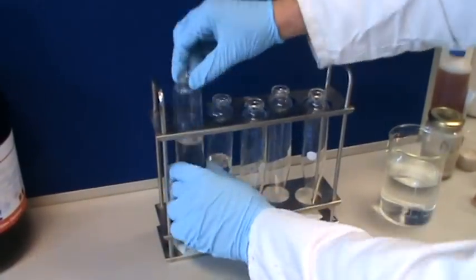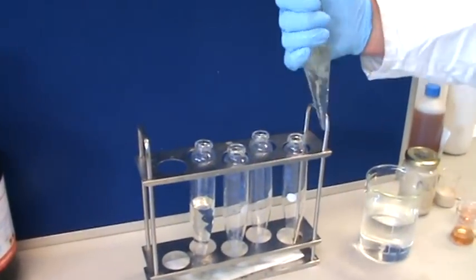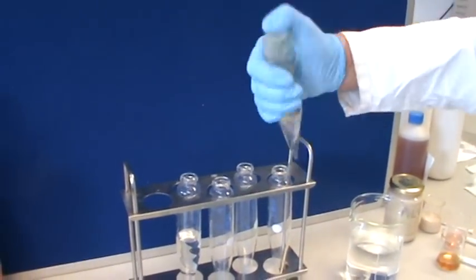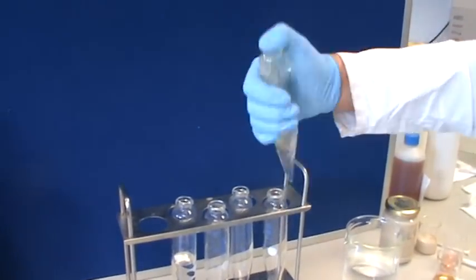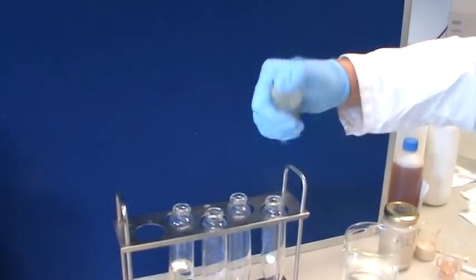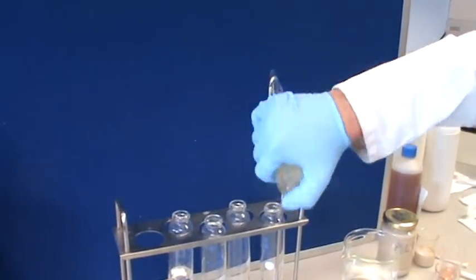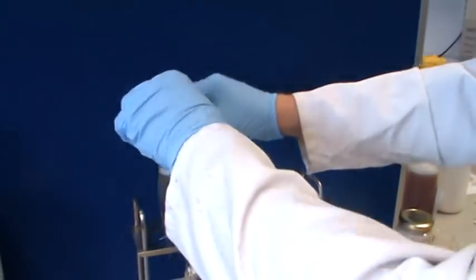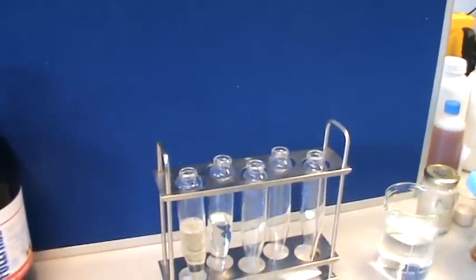Then we mix that with 20 inversions, as you do with your tank. This emulates some mixing in the tank then, Martin, with the water. Yes, and agitation, I guess. Yeah, you homogenise each chemical individually, otherwise they will not be compatible if you mix technicals.